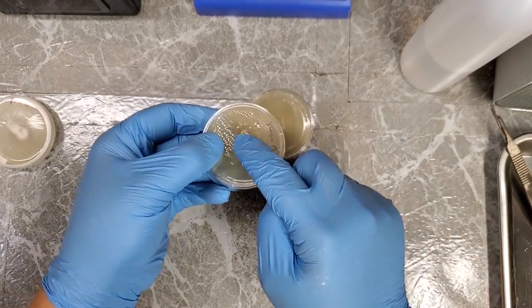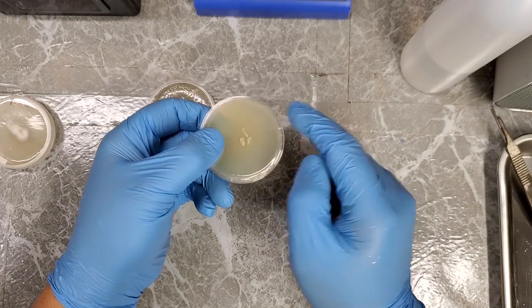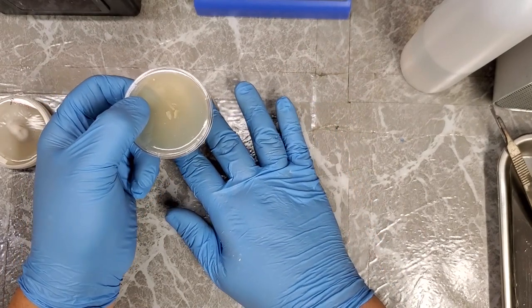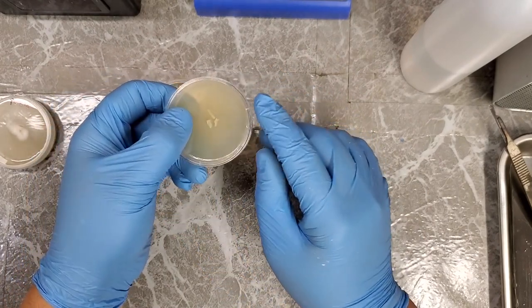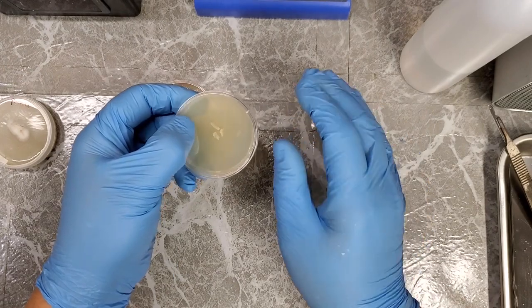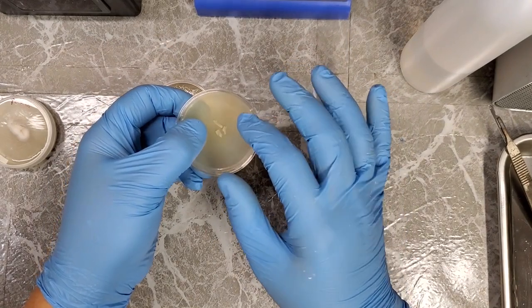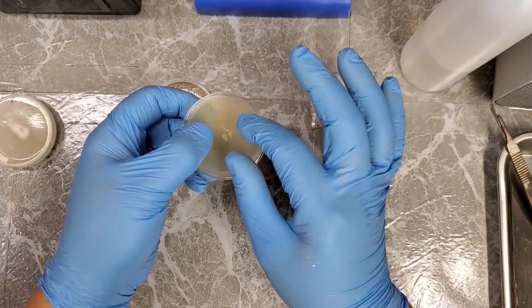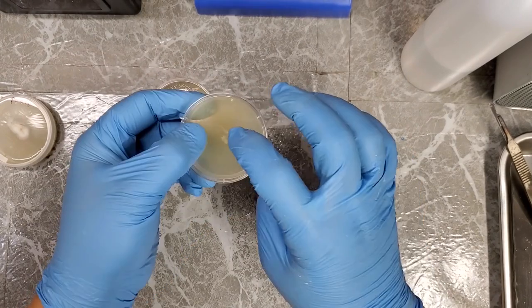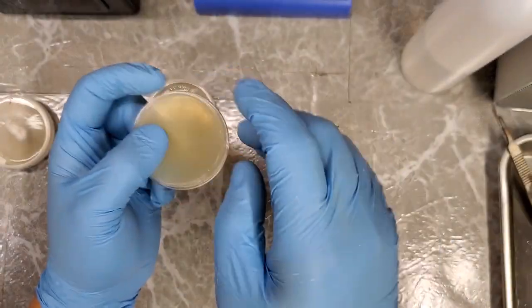See how this one has all this condensation on the top, which isn't really that big of a deal. But if possible, I like to give these a few days unwrapped to give them the chance to maybe evaporate off some of that excess water that may be present in the Petri dishes themselves. That way, whenever these are growing, it doesn't condense on the top like this one did, and then maybe rain down on the Petri dish while it's growing. And also, by letting it grow for a few days in the incubator unwrapped, that gives it a chance to start colonizing the agar, and that'll kind of anchor that little sample down onto the agar. And then you can wrap these after a few days and then invert them. That way, if it does condense, the top is now the bottom, and all of the condensation will be on the bottom of the Petri dish, not raining down onto the top of the agar itself.